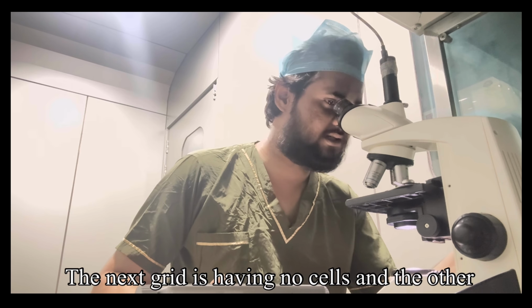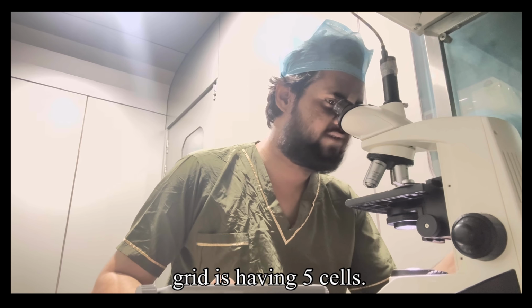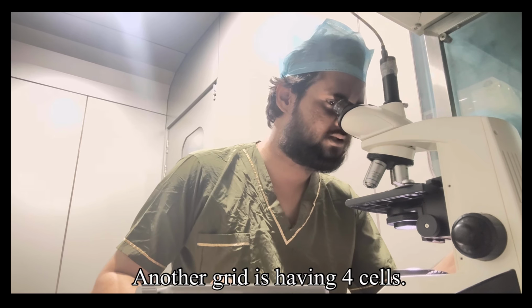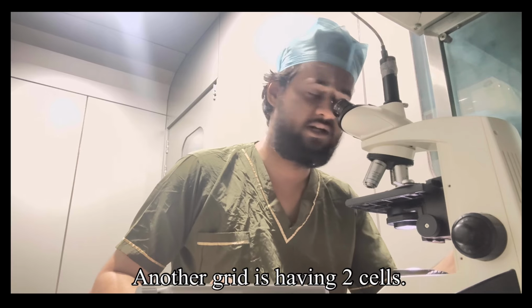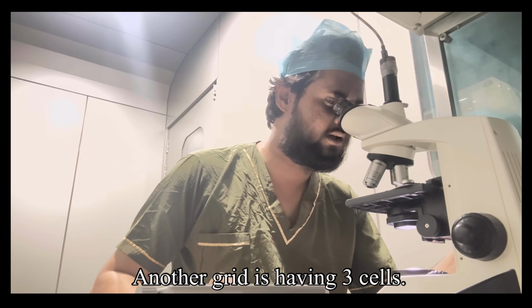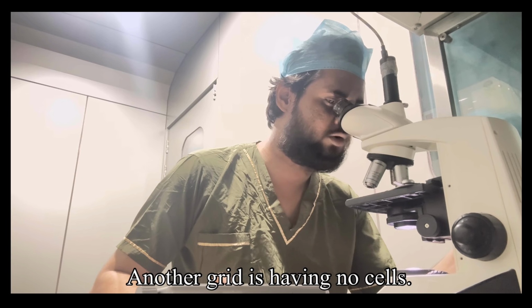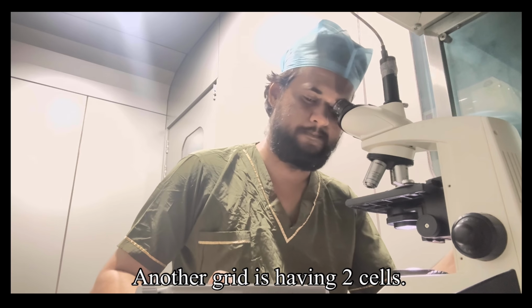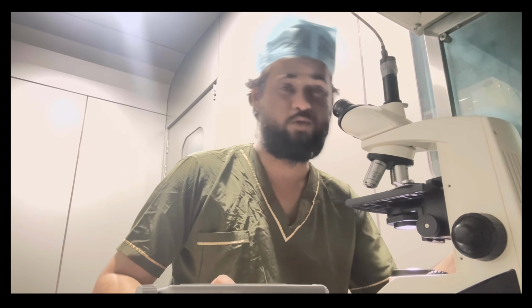The next grid has no cells, and another grid has 5 cells. Another grid has 4 cells. Another grid has 2 cells. Another grid has 3 cells. Another grid has no cell. Another grid has 2 cells. Now, how much have we counted? Let's wait.